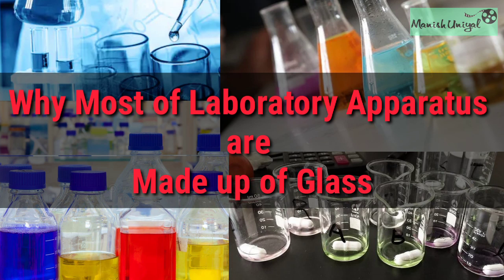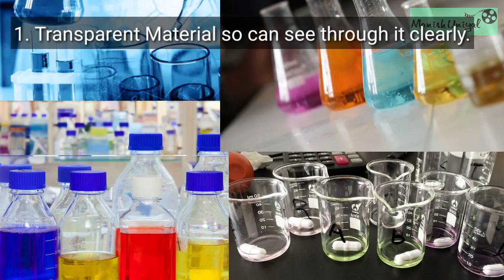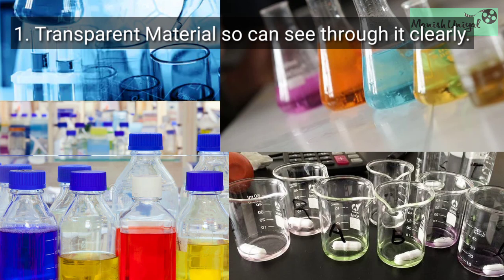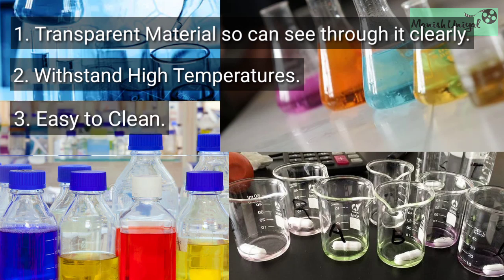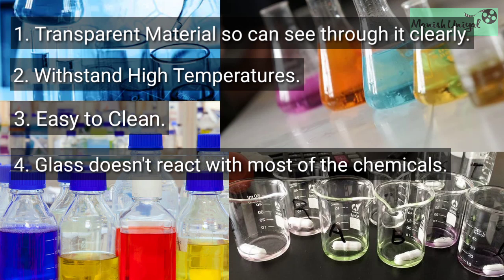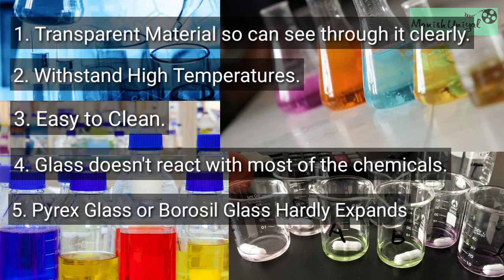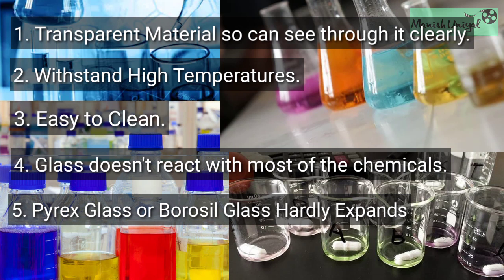Why are most laboratory apparatus made of glass? Glass is a transparent material and we can see through it clearly. Glass can withstand high temperatures. Glass is easy to clean. Glass does not react with most of the chemicals used in experiments. Pyrex glass is a special type of glass which hardly expands on heating, and such glasses do not break even at high temperatures.